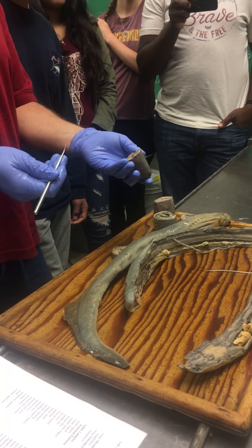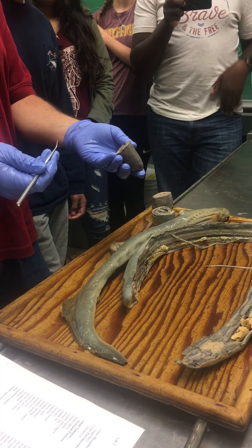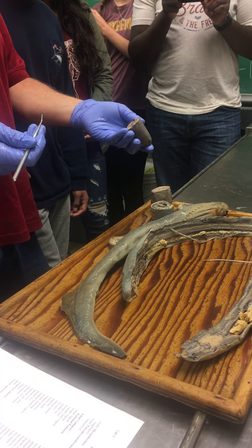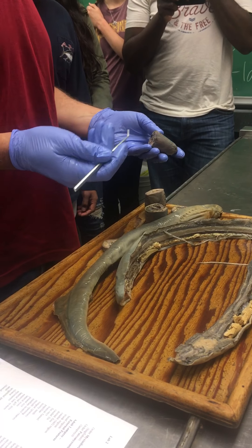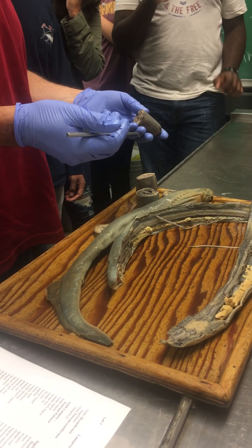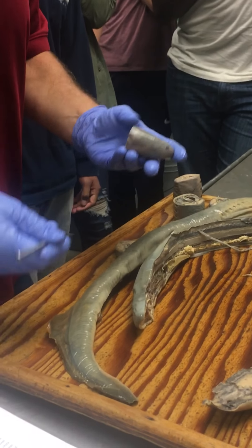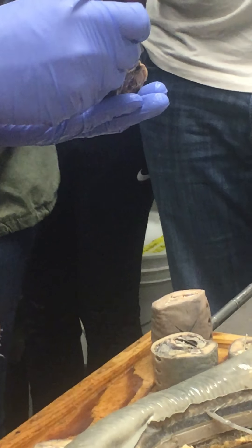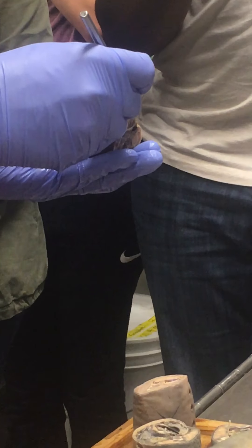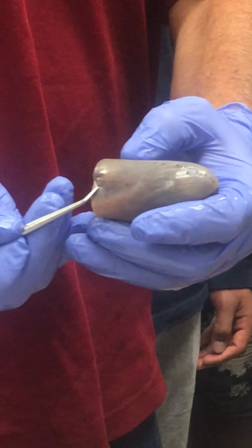That lightly pigmented area would be the pineal eye, sometimes called the third eye. It's actually common to all vertebrates in some form or another — in us it's become the pineal gland of the brain. Lizards often have a third eye on top of their head you can see quite nicely. Lateral eyes don't look like much in a lamprey; that is a lateral eye right there.